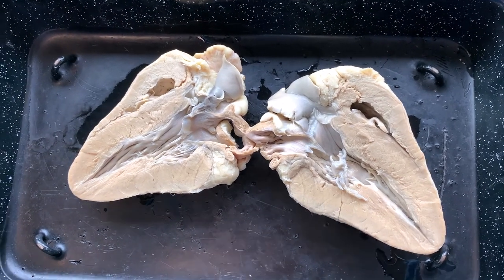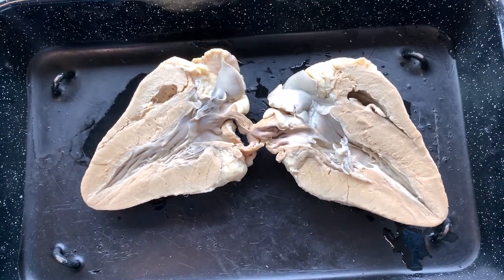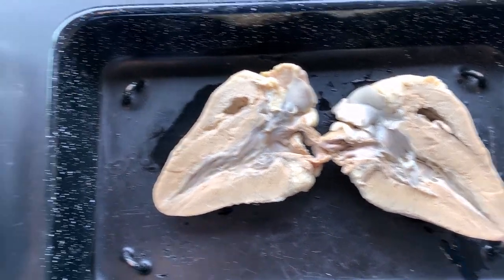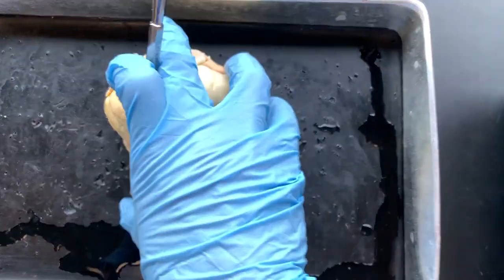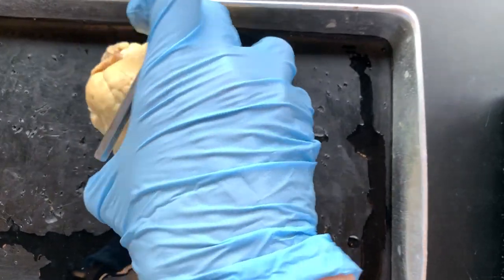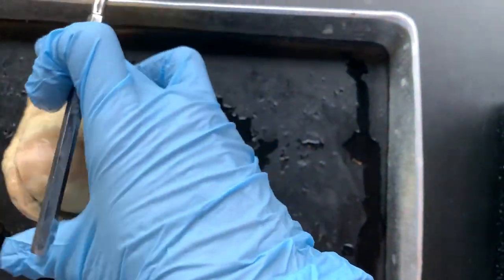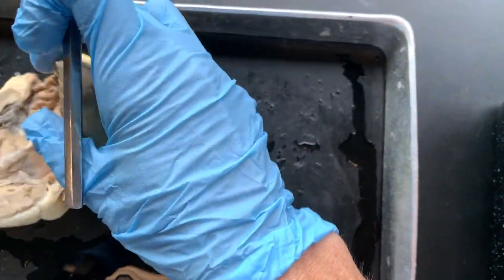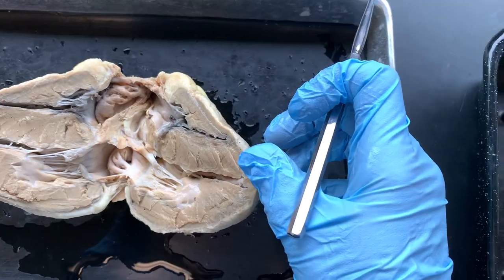Here's a sheep heart that's been dissected and opened. It looked just like this, and then all I did was open it up.